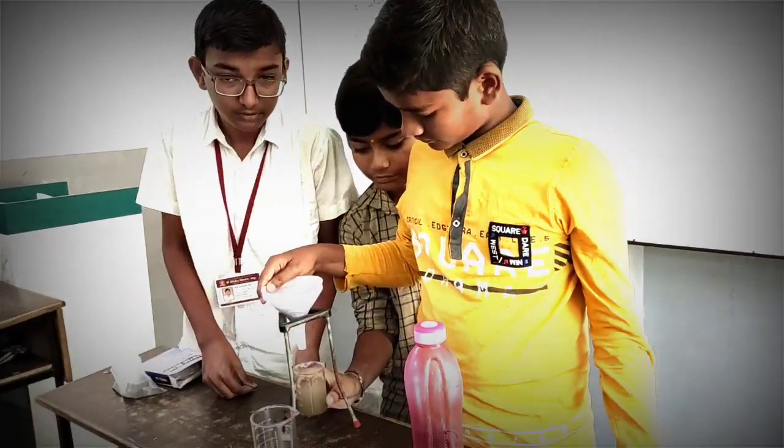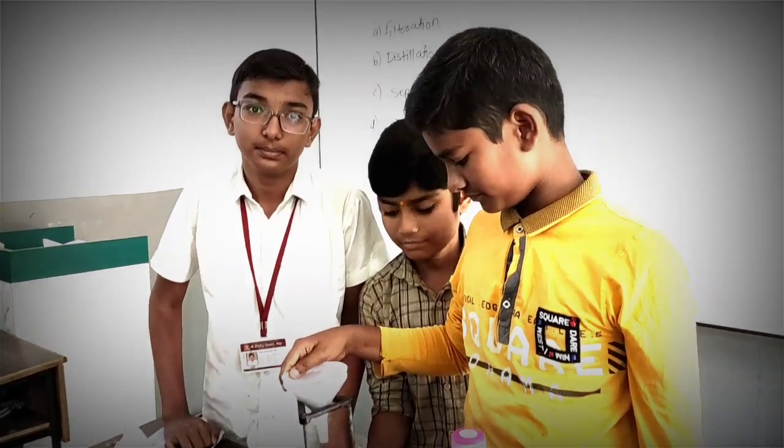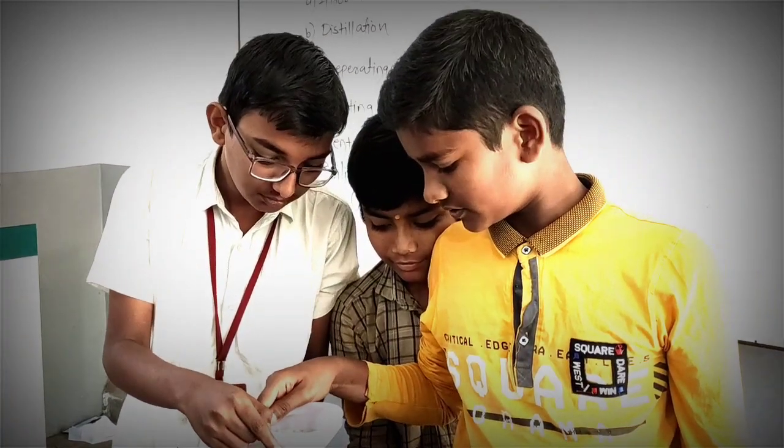This is which method? Filtration. You have separated solid and liquid. Got it? Yes, sir. Okay. Now look here, smile.